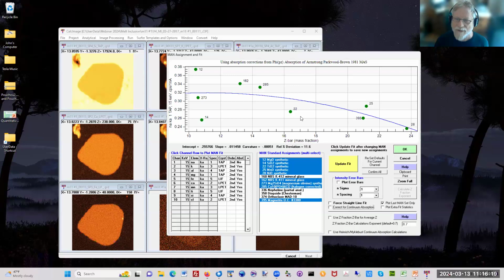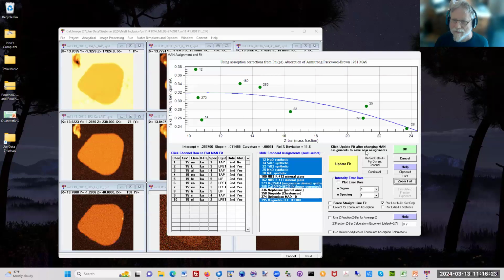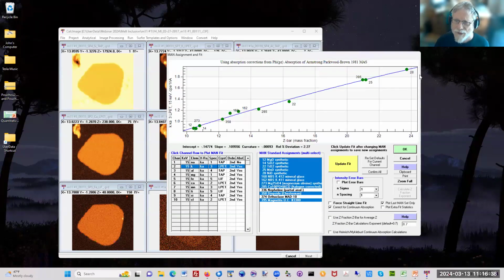The numbers here that you can see, let me zoom back out. The numbers here you can see, I'm not in PowerPoint, I have to remember that. The numbers here you can see are the standards down here. And then here's for potassium, and pretty good fit for potassium. That's what the absorption correction does.